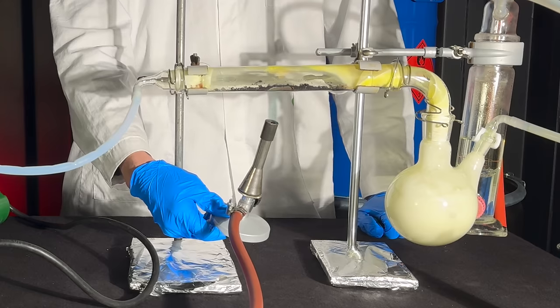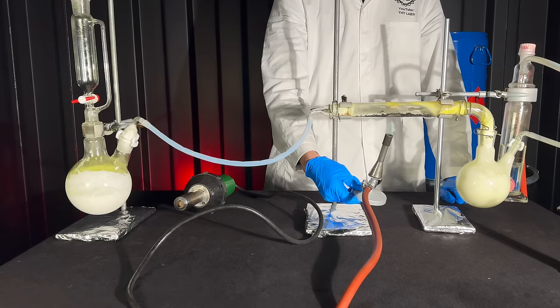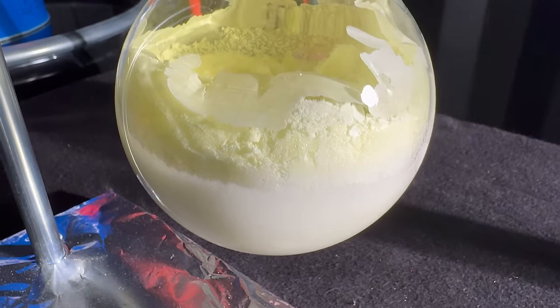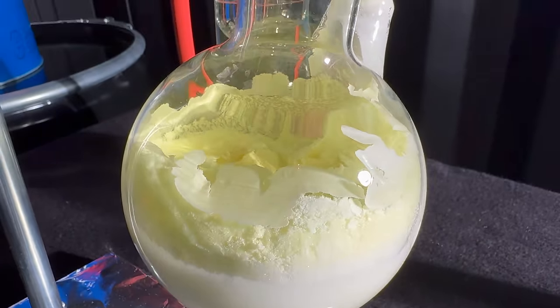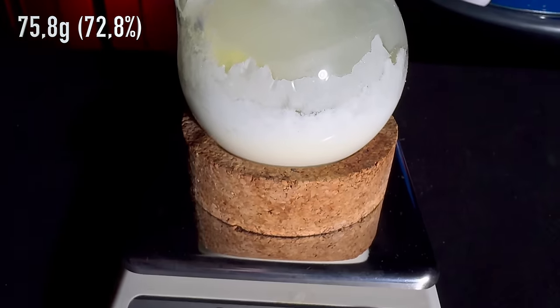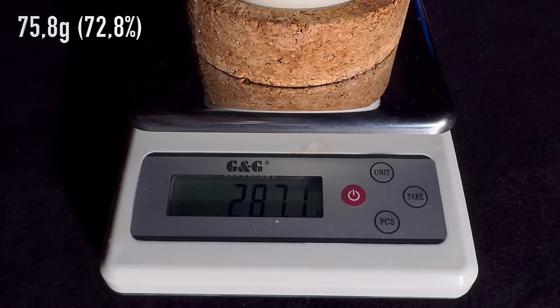At some point, all HCl had been added. After this, I heated all parts of the equipment to get the PCl5 into the collection flask. I ended up with 75.8g of product. That's a 73% yield.